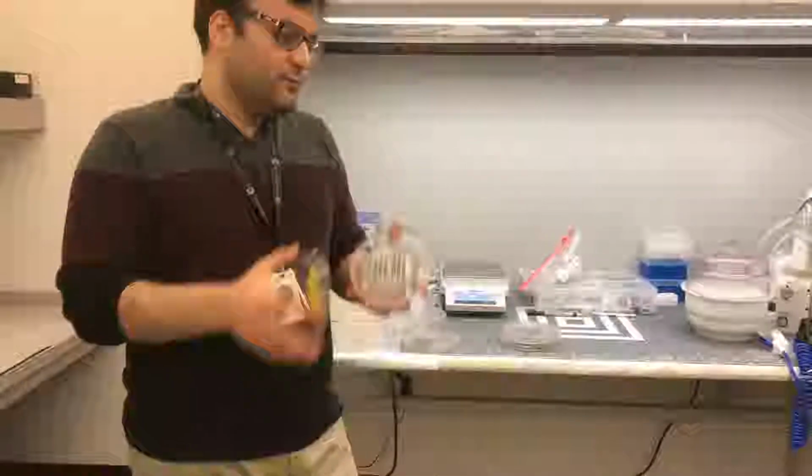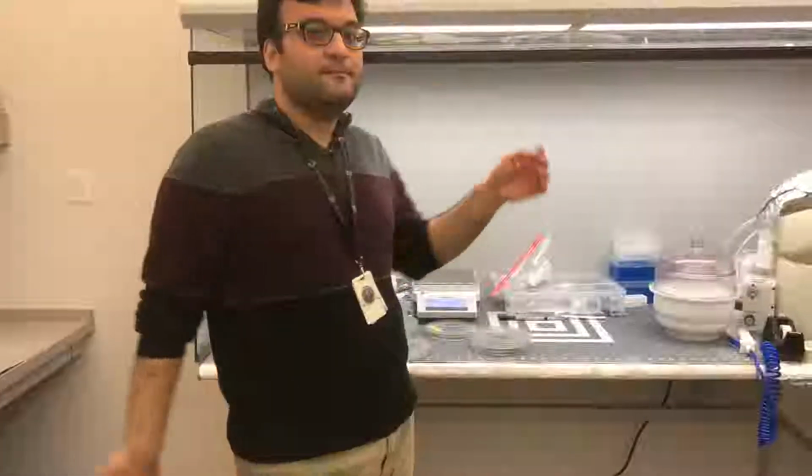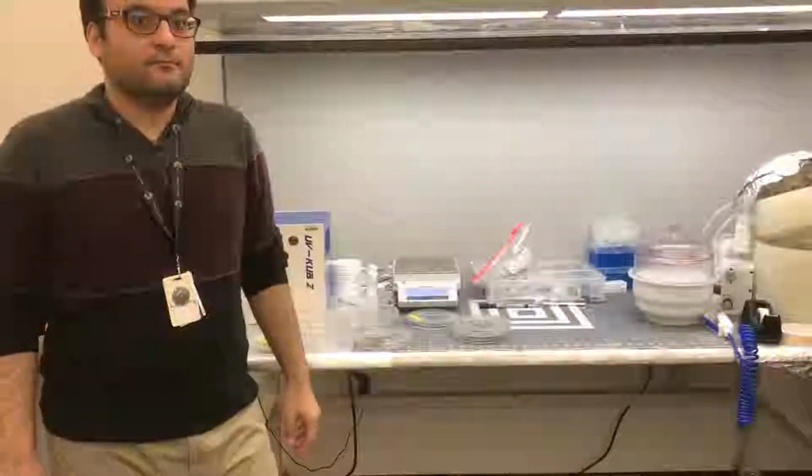For this, 60 gram, normally I put 30 gram in each of 2 cups, and then you pour one after another.